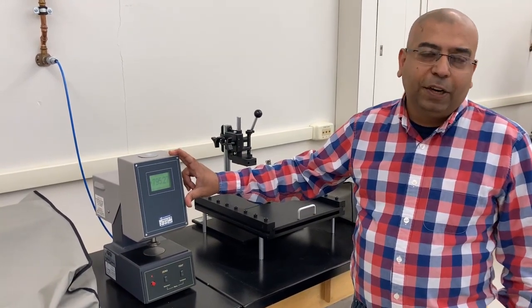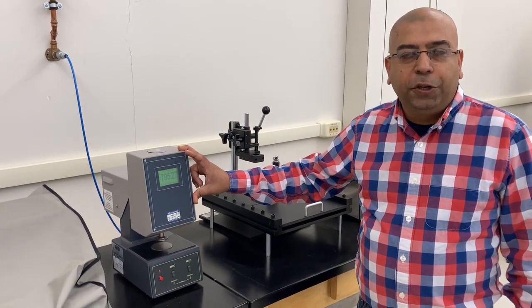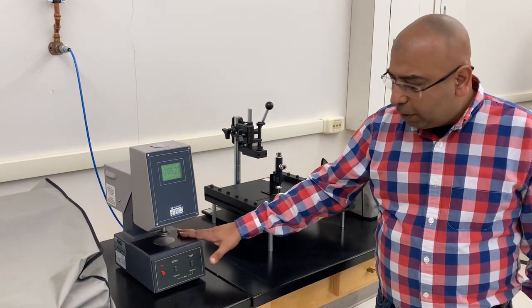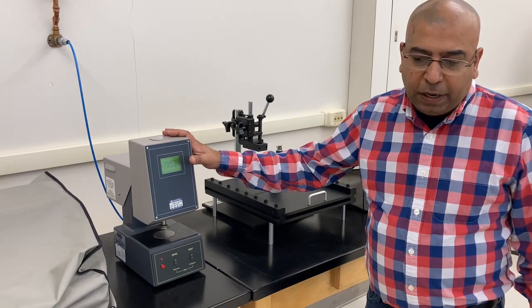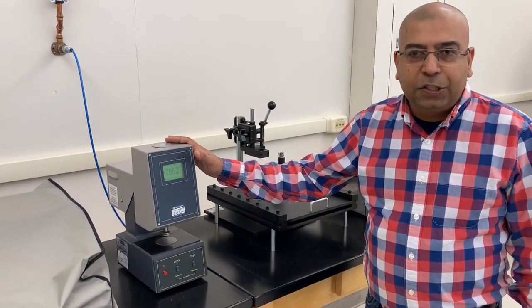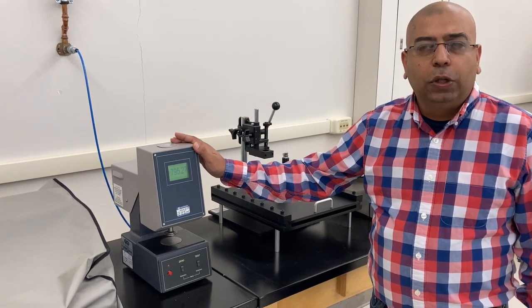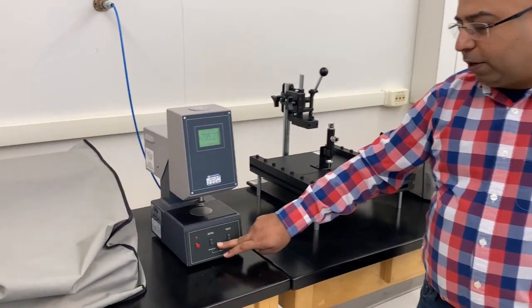But particularly in the plastic industry, we use mils. That's the term we use. So you have the units right here in mil. The first thing that you do when you do any measurement, for example, if you have a balance and you are weighing, the first thing that you do is zero the instrument. So the same thing we are going to do, and you see the zero button right here.